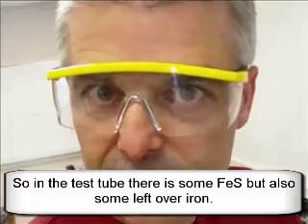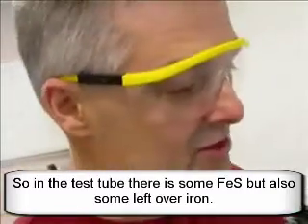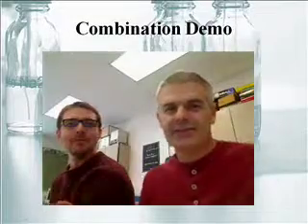It smells like I'm at Yellowstone. Yeah, well, it's because sulfur stinks. I'm going to go put this in the hood. That was so cool!